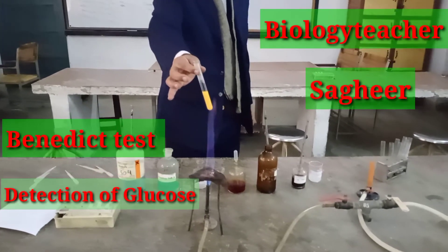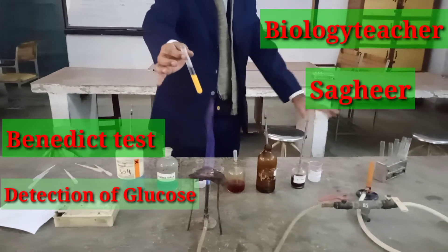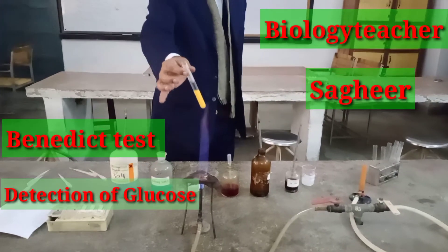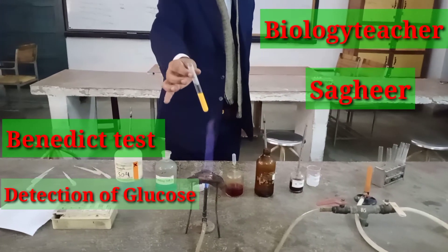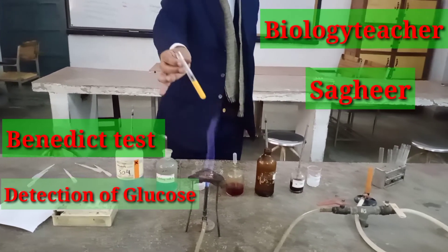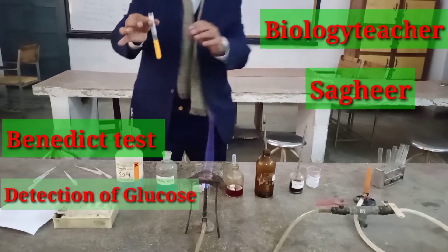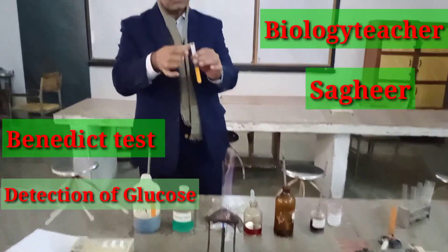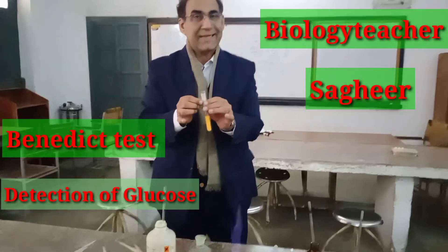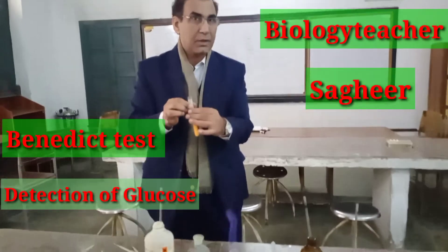If you allow it to stand for some time, you would see the brick red precipitate. The precipitate forms at the bottom of the solution.